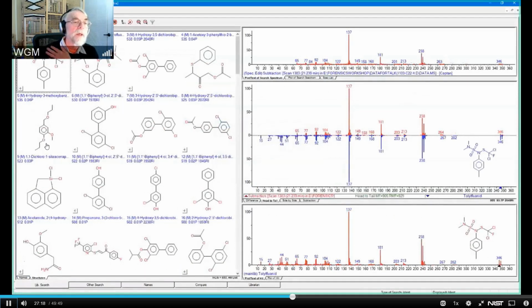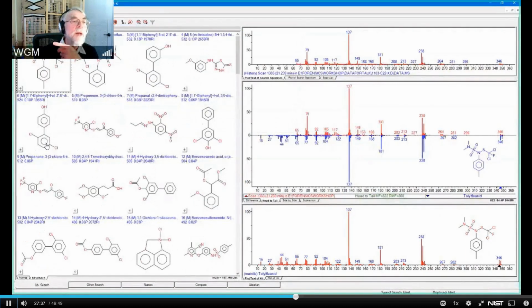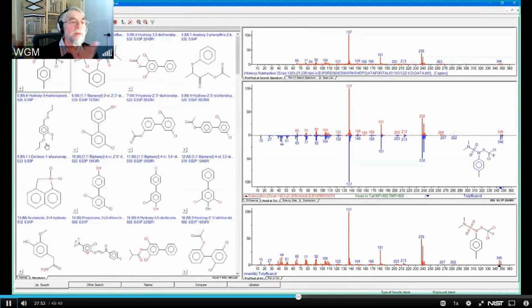And now, of course, this is not a surprise. I get exactly the same first hit. But the difference is my first hit now has a 905 match factor and a 93% chance of being correct, whereas what I had before was an 822 match factor and an 84% probability of being correct. So I have, in effect, gotten a better match for my data. And I did that simply by subtracting the minor component that I had found by subtracting the major component from the raw data.